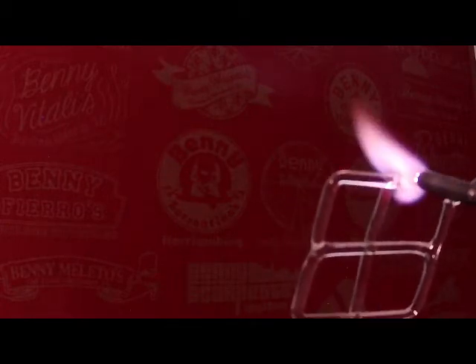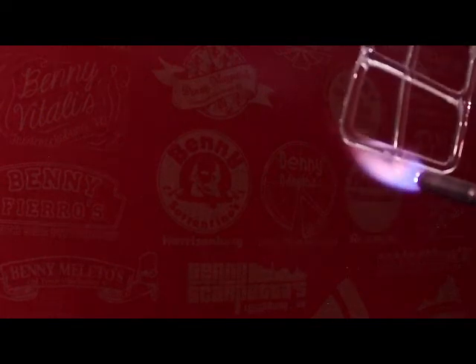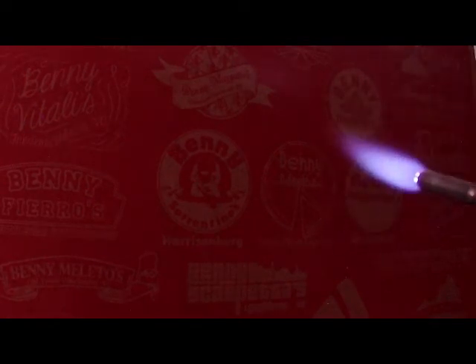So now at this point, I've got this effectively tack welded on, but it definitely needs some work. And you can see, hopefully, that the rods in the center are not touching at this point. So I am going to correct that. But before I do that, I want to make sure that on both ends, I have a strong enough weld that it won't break on me as I'm working the center. And obviously, a glass rod being very rigid, you might find yourself having to heat up here and then push down somewhere else to bring things into position.